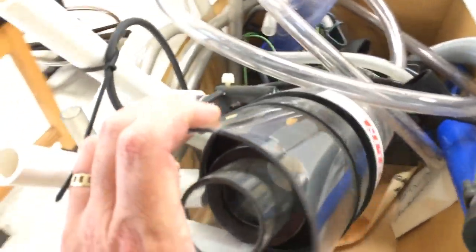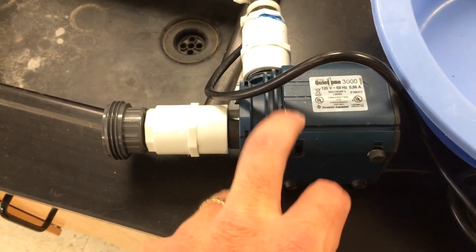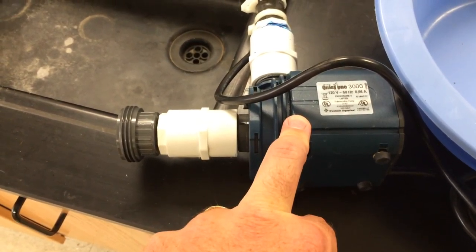There's two things we're going to need to get it up and running for experiments. One, we need a new power head for the protein skimmer. And then two, we need a new circulating pump. This guy is on its last leg, so we just need a new one. It's about to fry, probably won't even fire back up again.